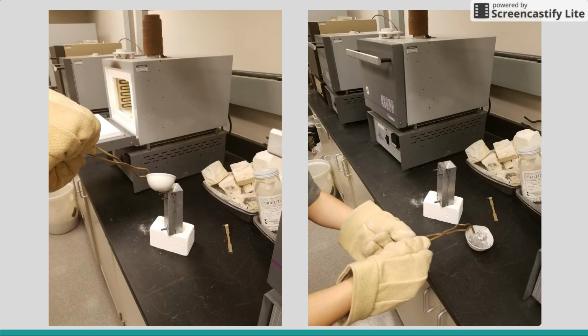Three samples were cast into molds and were all cooled in various ways. One mold was quenched in room temperature water, another was air-cooled, and the last was furnace-cooled. The different cooling rates affected the microstructure of the samples. This was because they gave the liquid metal different times to recrystallize, which affected the final grain size of the cooled samples.